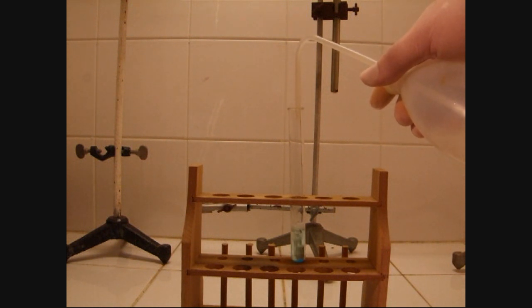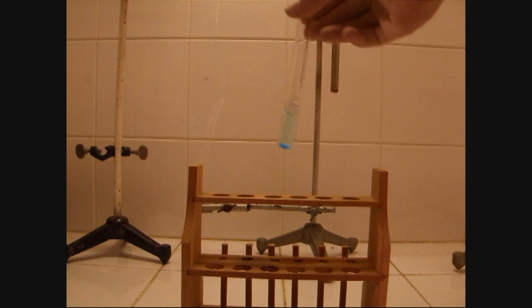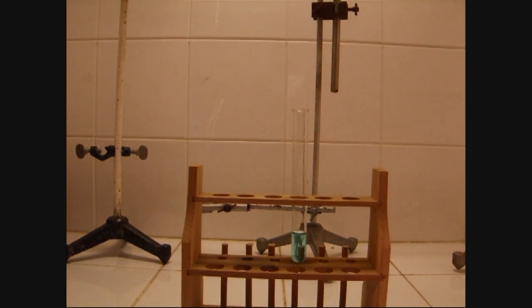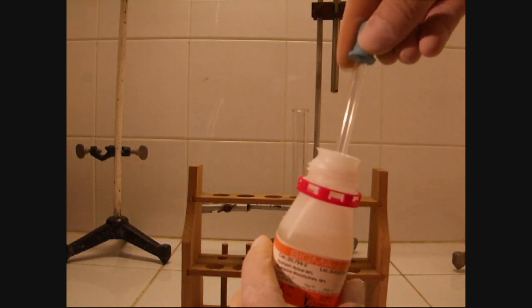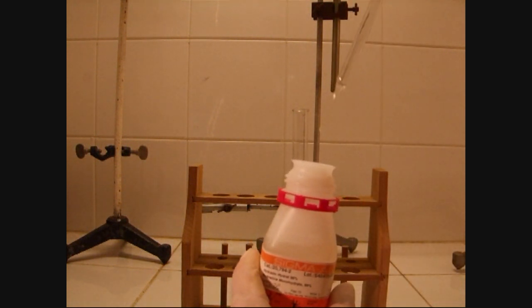At first, a few grams of copper sulfate are dissolved into distilled water. When the copper sulfate is completely dissolved in the water, a few drops of hydrazine are poured into the test tube.